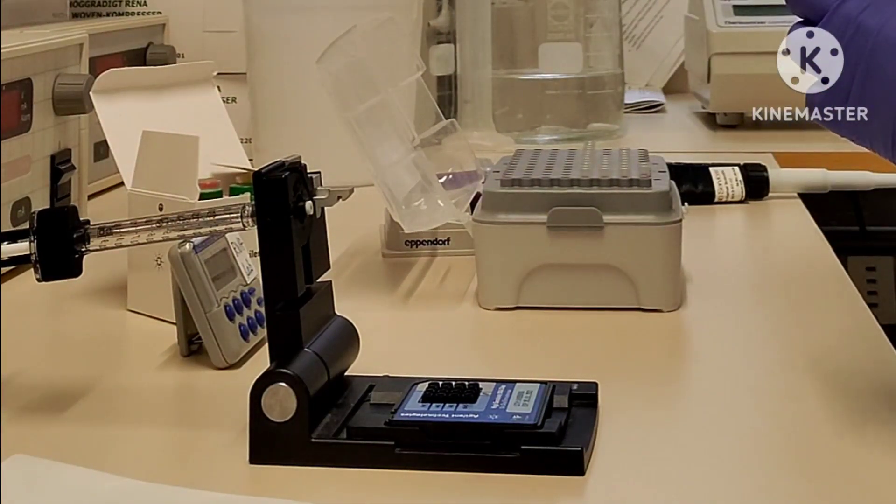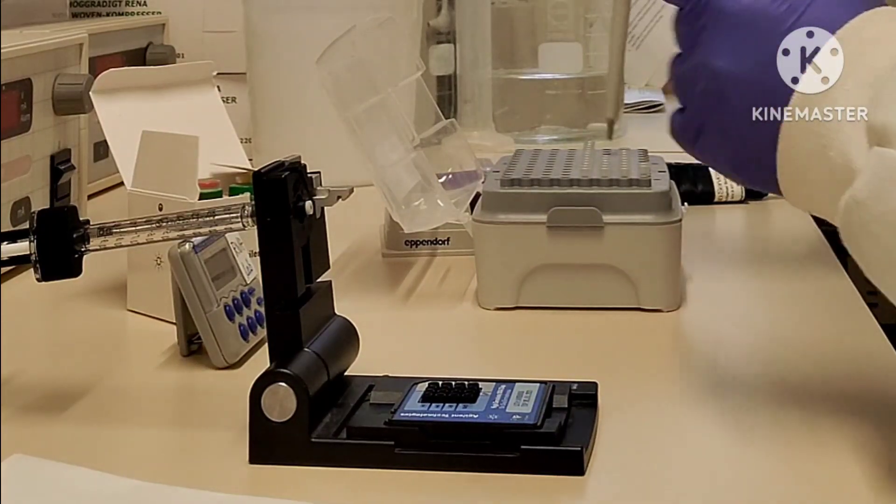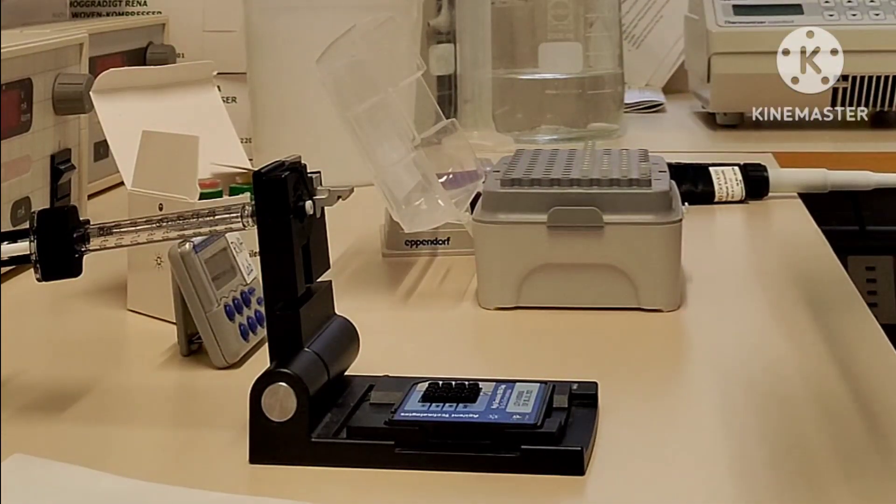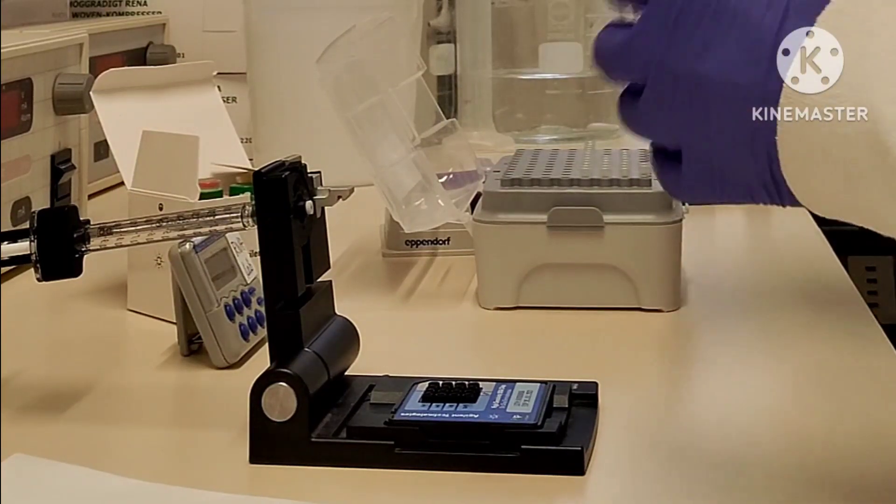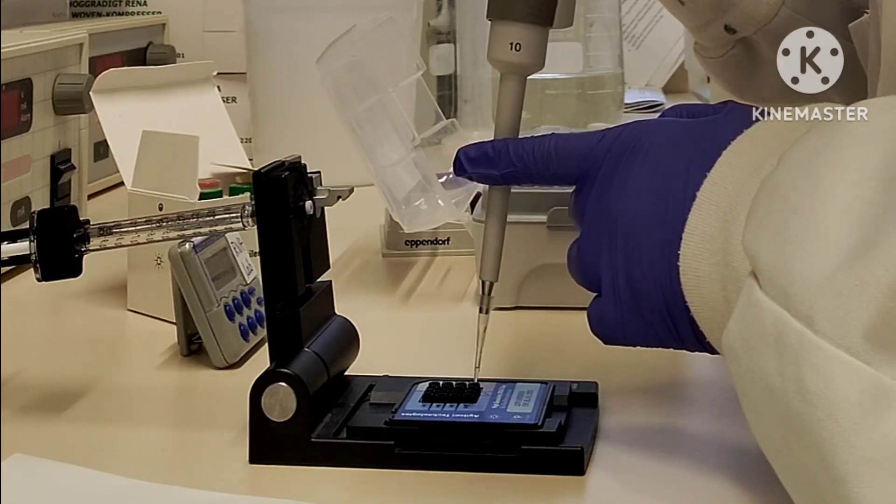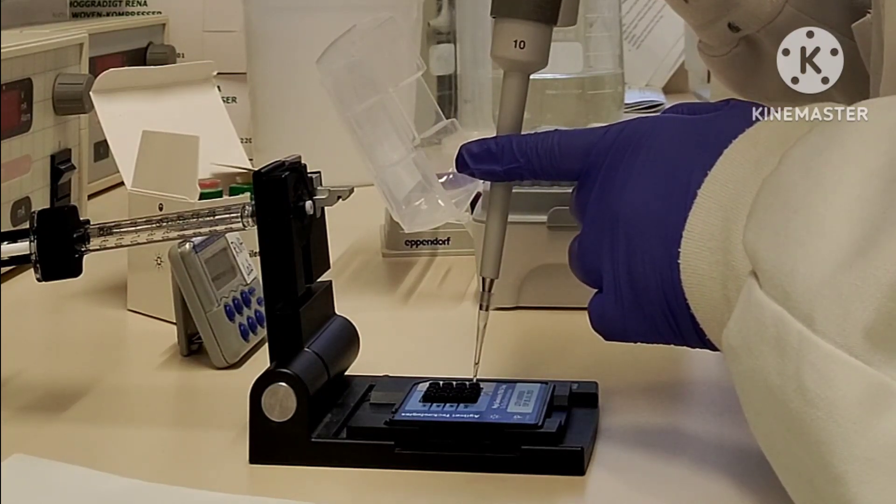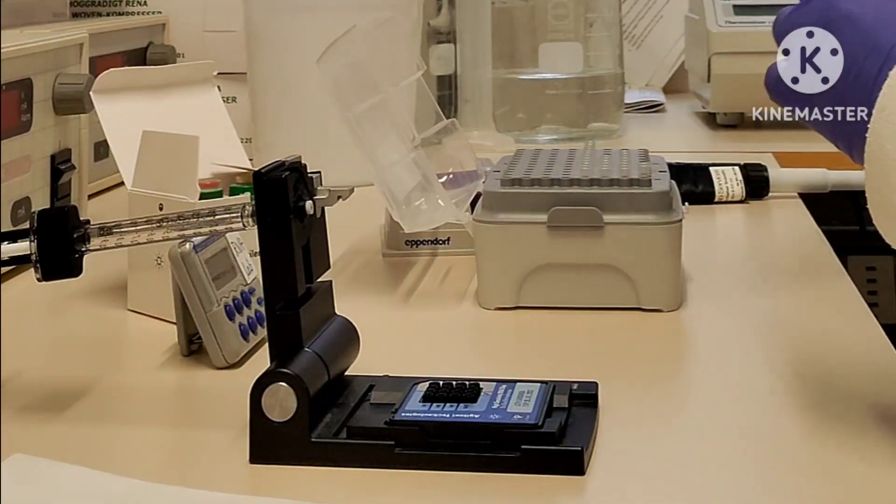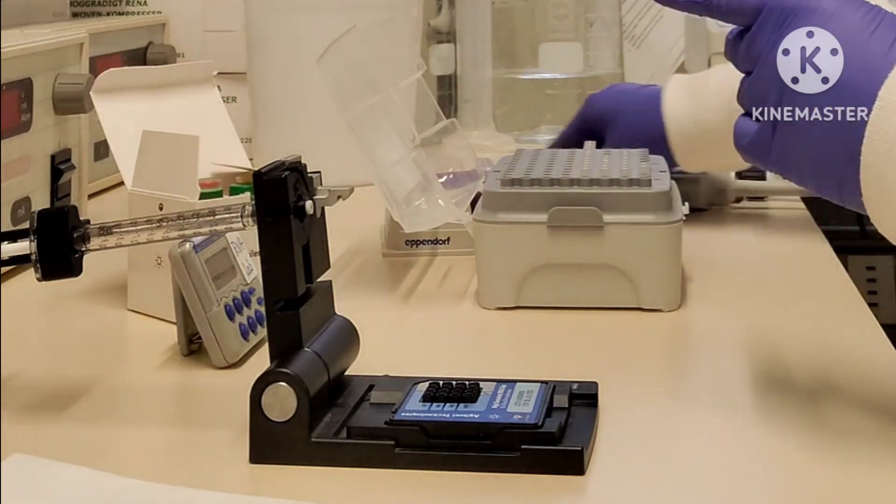One more thing, guys: whenever you pipette, make sure you are not adding bubbles to the well, because it will hamper your chip preparation. Make sure you don't add bubbles in your wells, and if by chance you do, just try to break them.